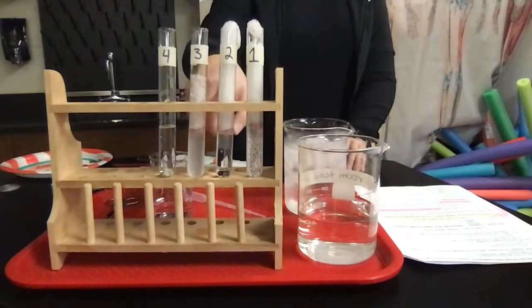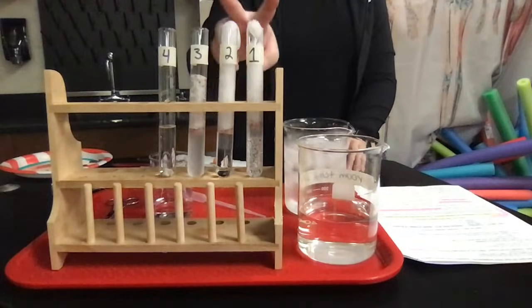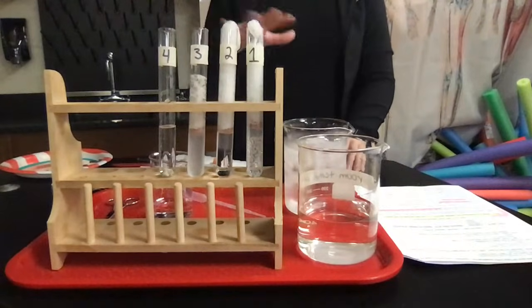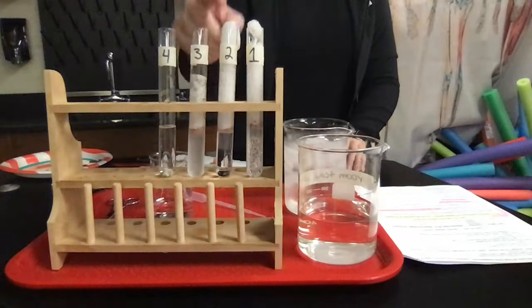That's probably because of the heat from this reaction and the ones from test tubes 1 and 2, plus the environment around us. It's kind of warm in here with all the boiling water going on and all our hot plates. It's heating up this water, which is now causing this reaction to proceed better, at a faster rate.